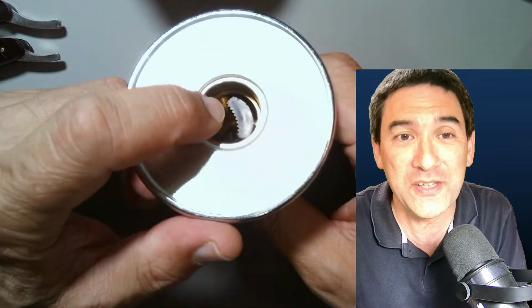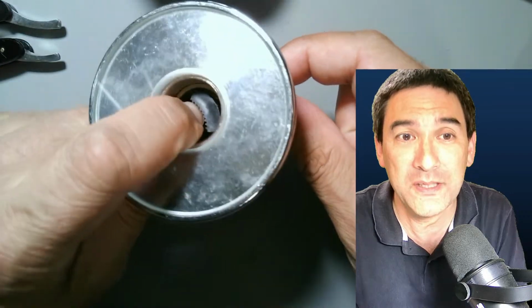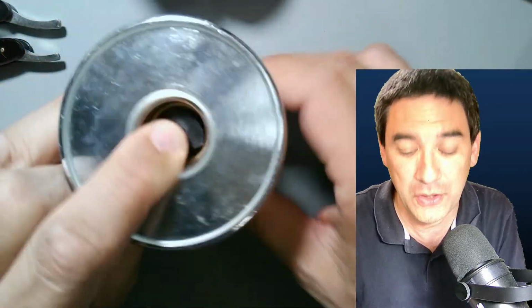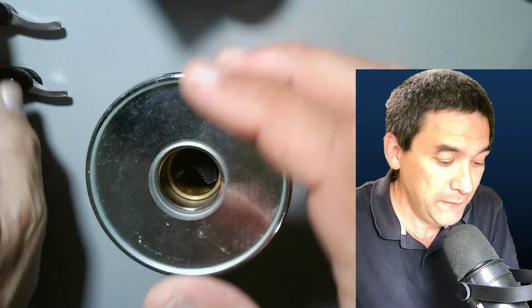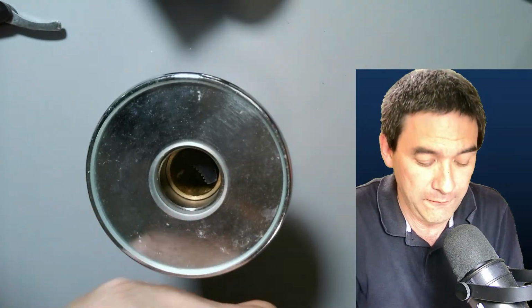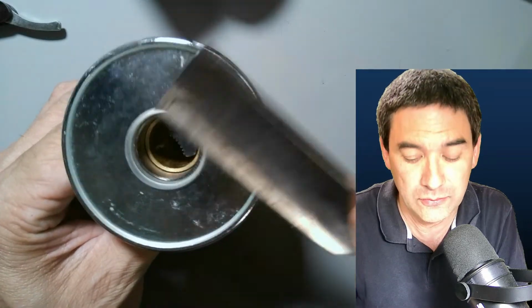And you see that over here, there's a clamp in here. You can use this screw here to clamp the specimen, and by rotating this bottom part, you're advancing the specimen up, and then you can use a very sharp knife, like this one over here, and then you slice across it. I'm going to show you how to do that.